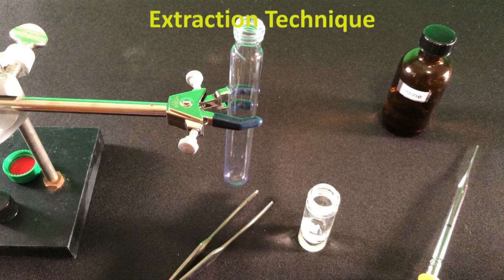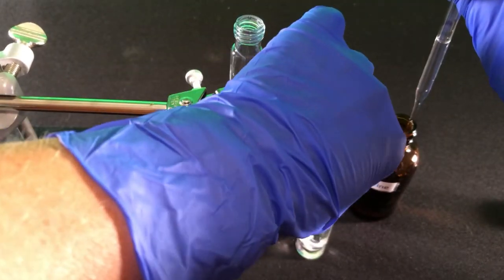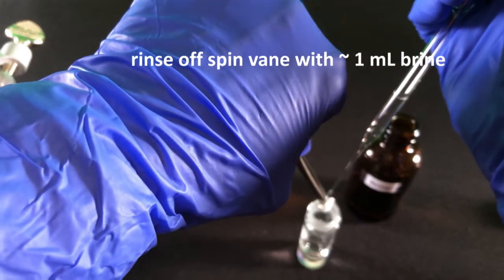Use a screw cap test tube large enough so that it is no more than 3/4 full. You want room to sufficiently mix the solvents by shaking. Using tweezers, remove the spin vane from the reaction vial. Rinse off the spin vane over the vial with 1 ml brine.